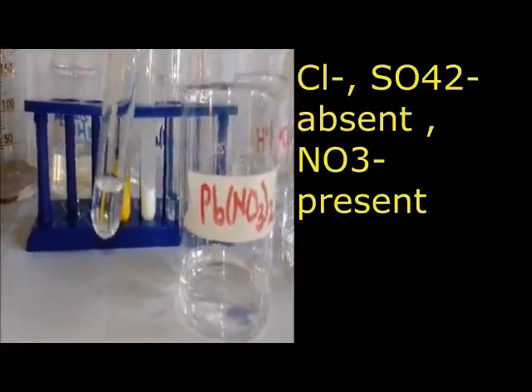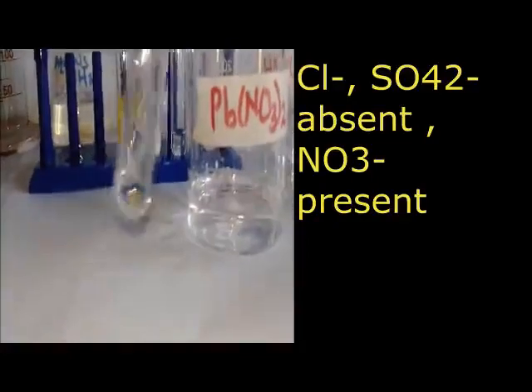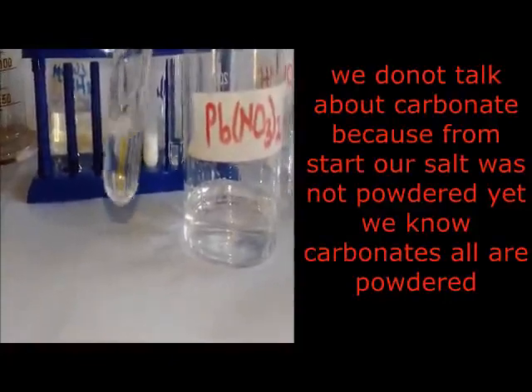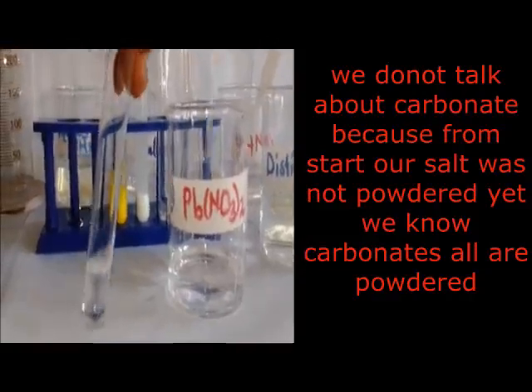If carbonates were present, our salt would be powdered. That was the first preliminary test for carbonates. If it was a carbonate, it would be powdered. We discovered at the beginning it was crystalline. Being crystalline, we expect sulfate, chloride, and nitrate.